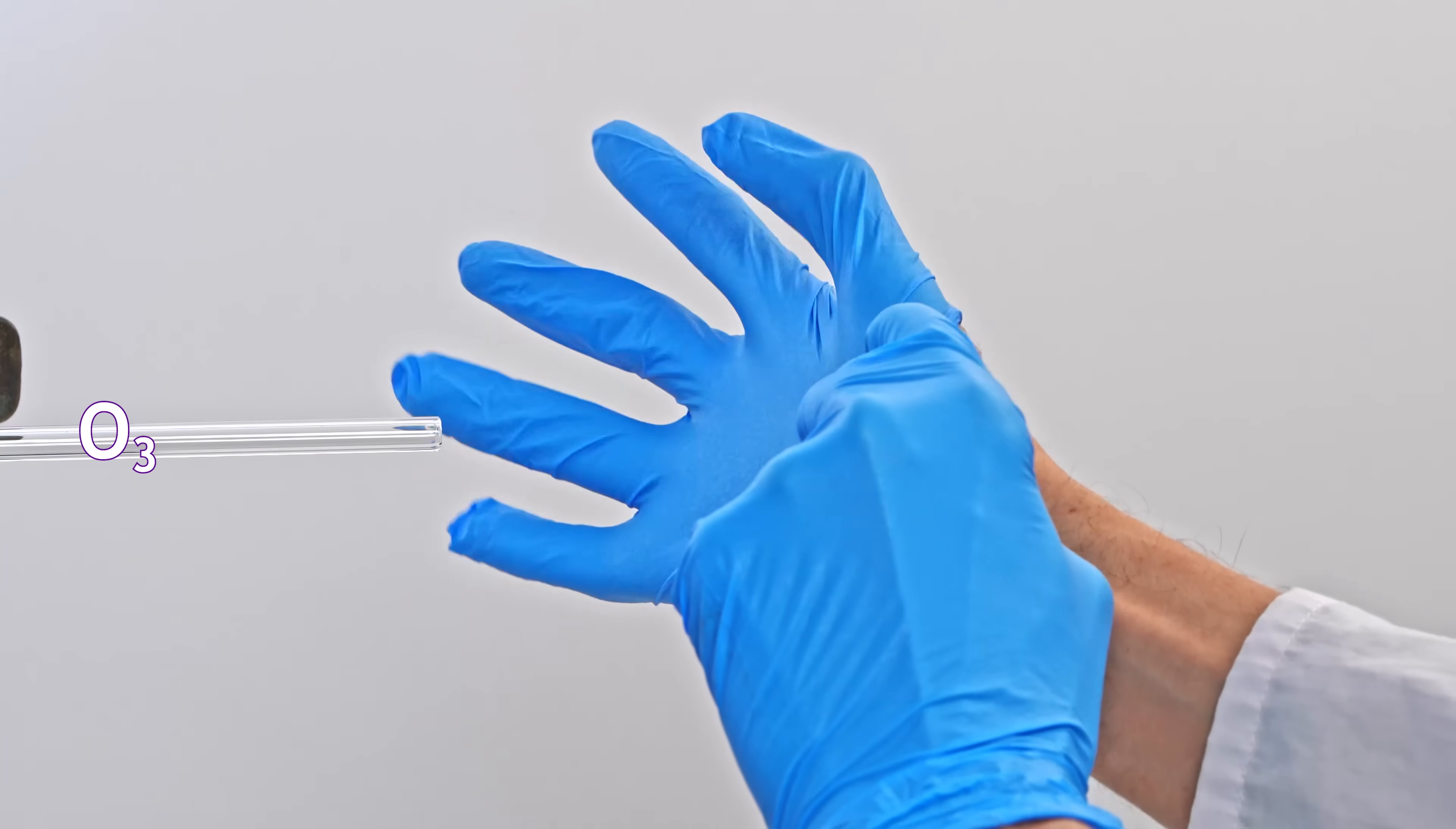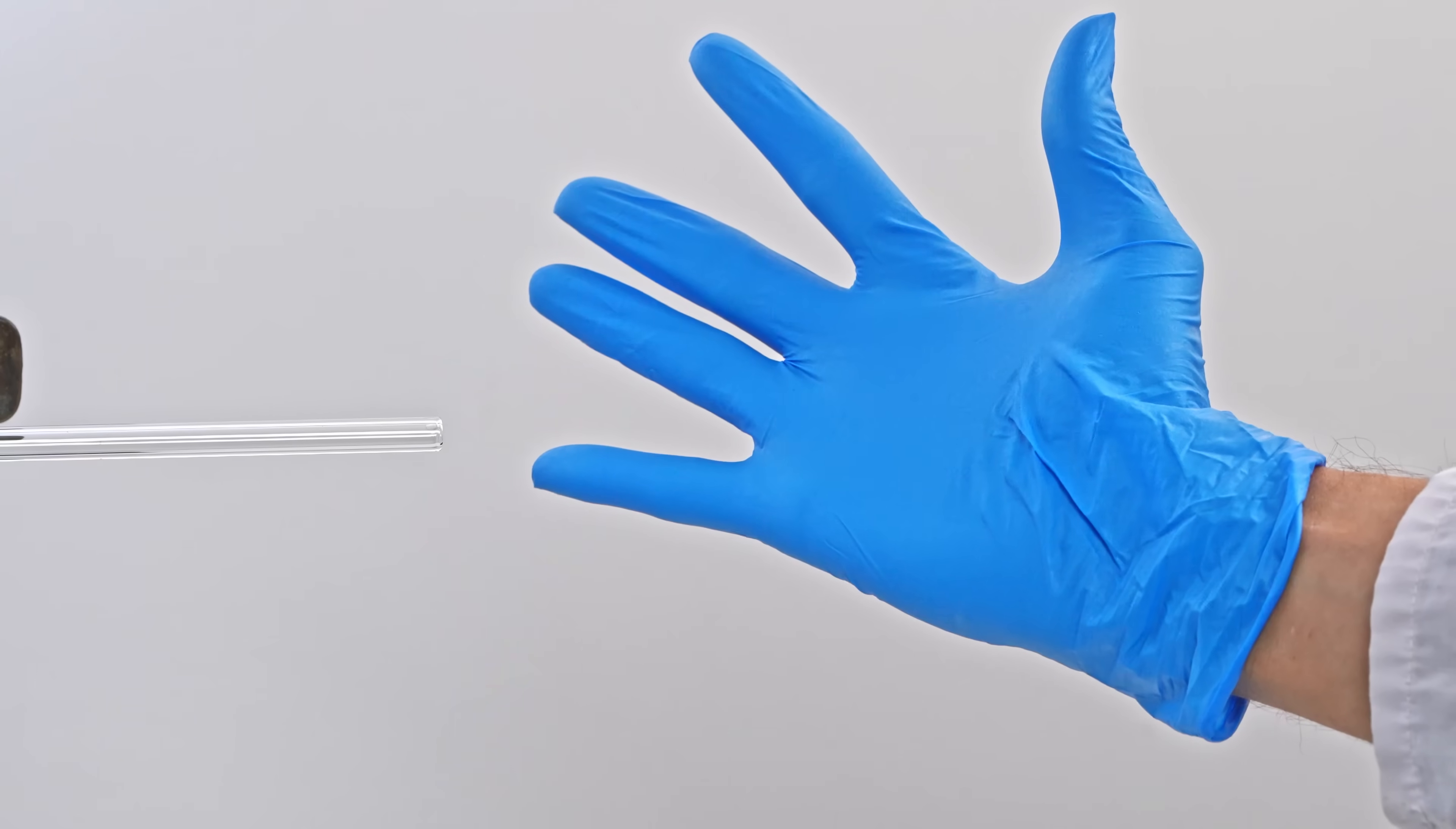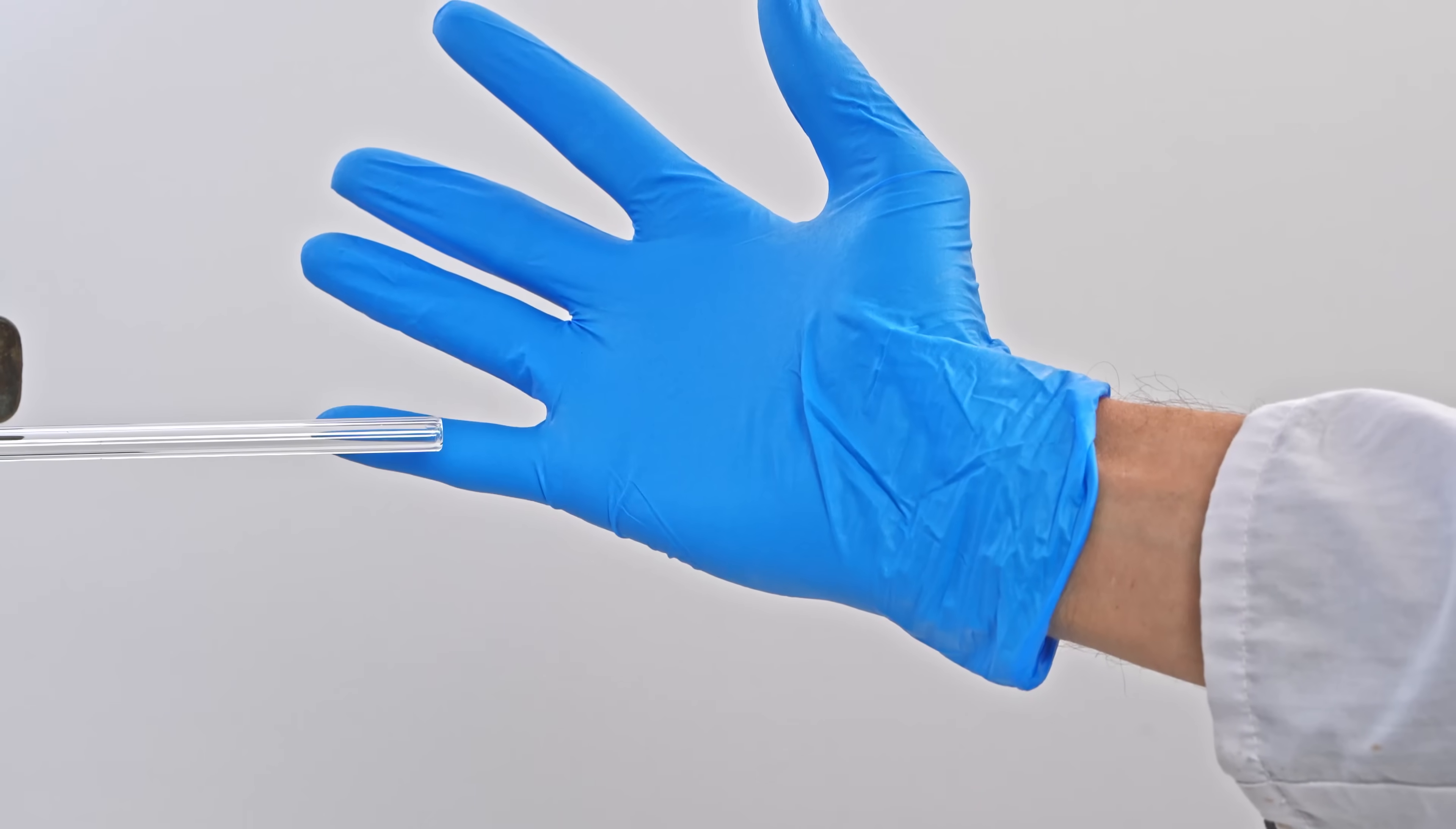Fun fact, during this experiment I went through more gloves than ever before. Ozone quickly degrades materials like latex, nitrile, and isoprene.